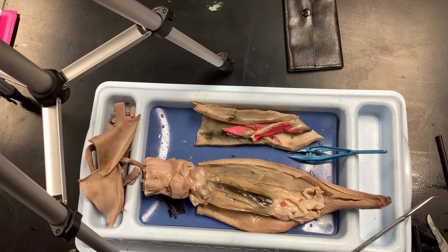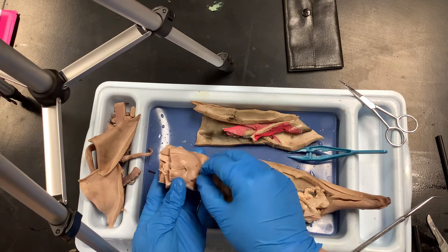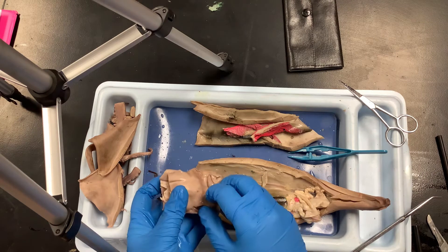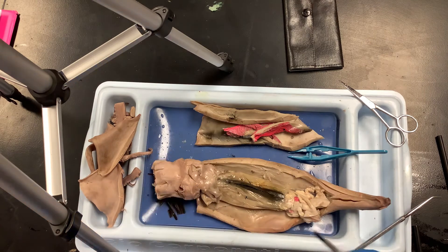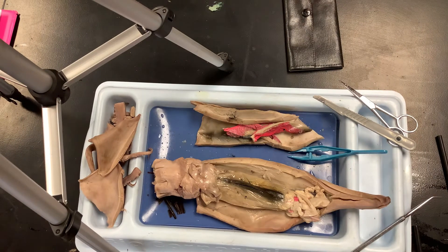One other thing you can look at is the eyeball. It's in the bottom part of the body and may have receded a little, but there are obviously two on either side. You can try to get it out — when you pull it out it snaps in half. That's the hard part of the eyeball — there's one eyeball there, and another one right there.